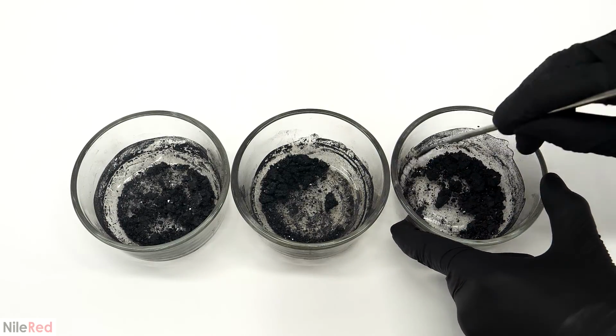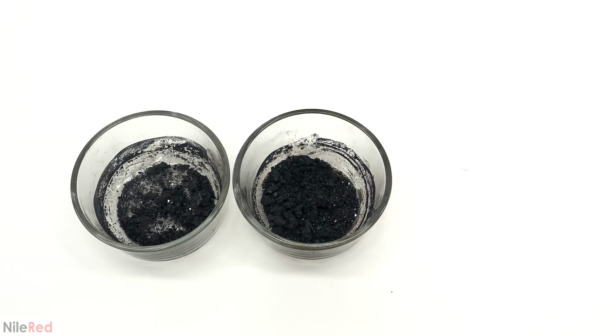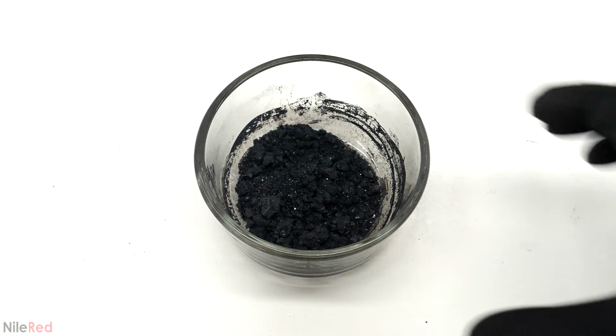At this point, it was a really dry powder, and I scraped off as much as I could from each bowl and combined it all into one. I also weighed it and found that it was a total of about 26 grams.